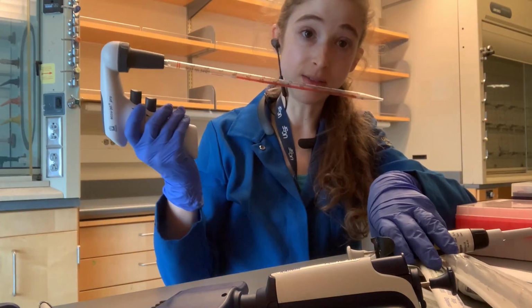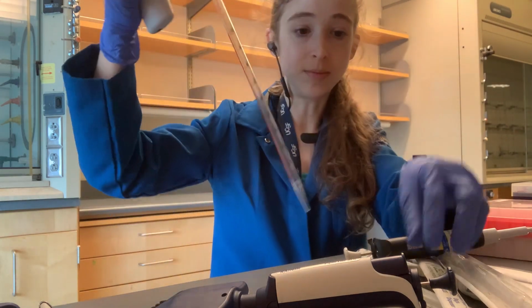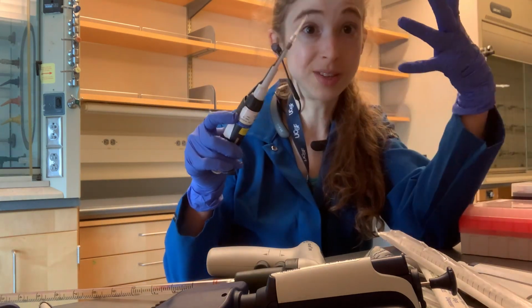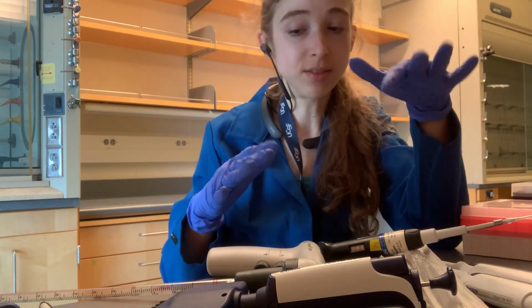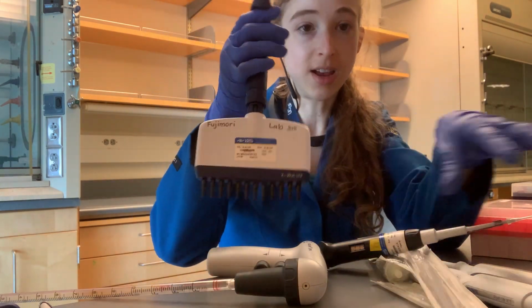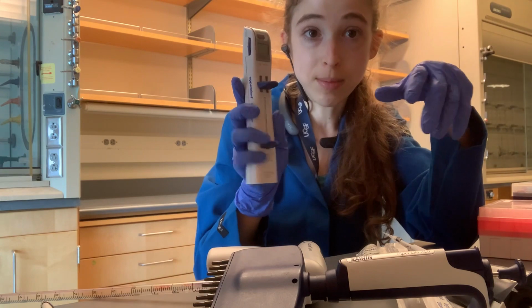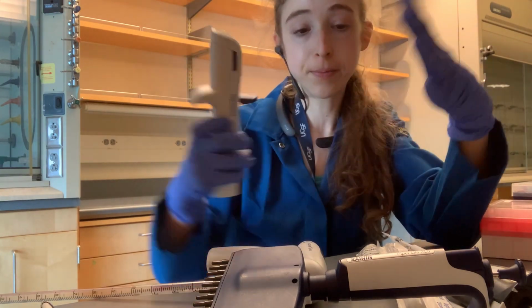We have the serological or volumetric pipettes where they have bigger sizes like 5 mils, 25 mils, 50 mils, etc. When we're talking about the micropipettes, these just go up to 1 mil typically, and then others go up to 5 mils, but typically they're smaller volumes. And we also have multi-channel pipettes, which are like the micropipettes, but allow you to do multiple steps at the same time. And then repeater pipettes, which let you do the same volume over and over and over.